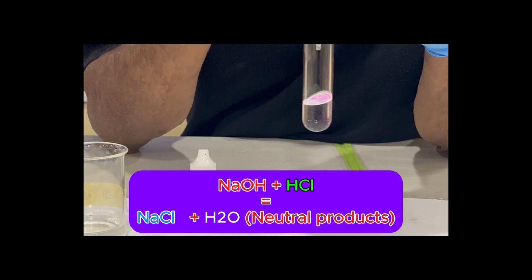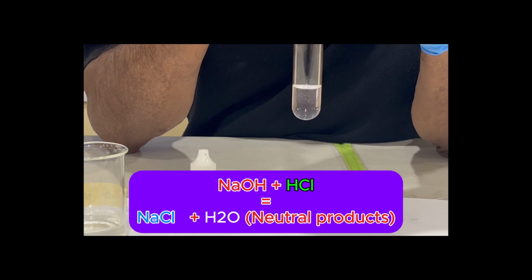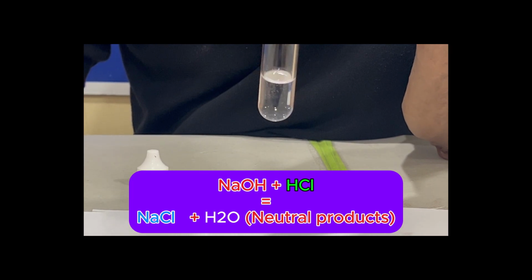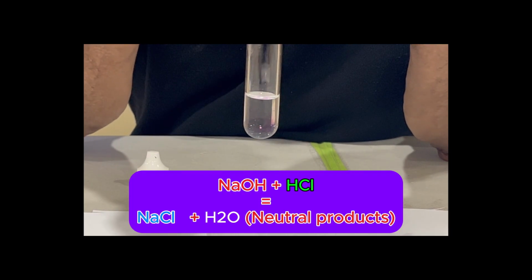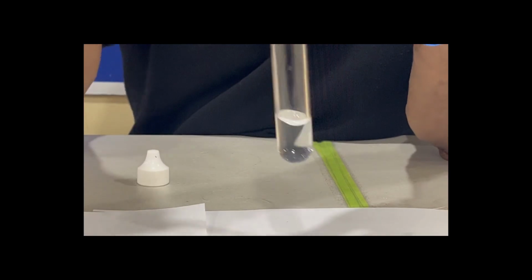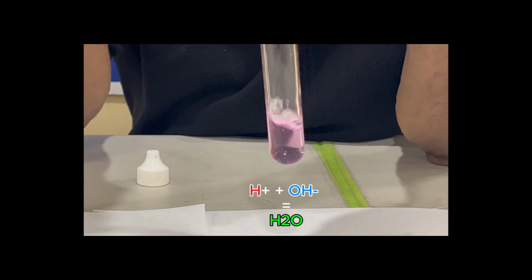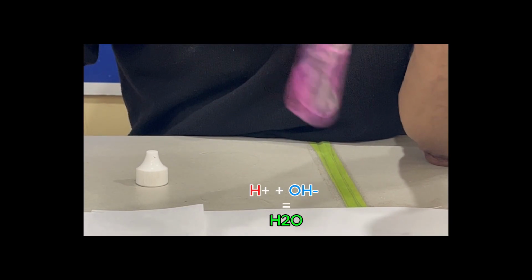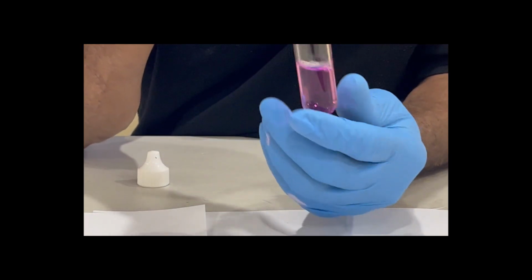More and more salt and water is being formed. Okay. More of the acid is being neutralized by the base. When you see that pink color persisting there, it is indicating to us that the end point of this neutralization reaction is about to be reached. Okay? See, it's coming there now. 1 drop more. That's because we need to mix it up well. It's showing at the top because the base is at the top and it's not catching the acid at the bottom there. Okay? So you can see that the solution stays pink now.